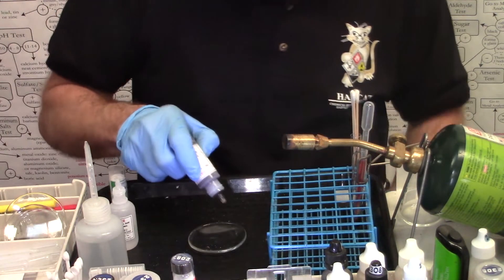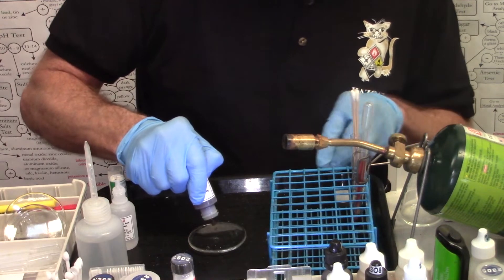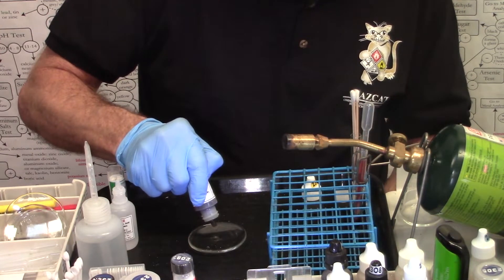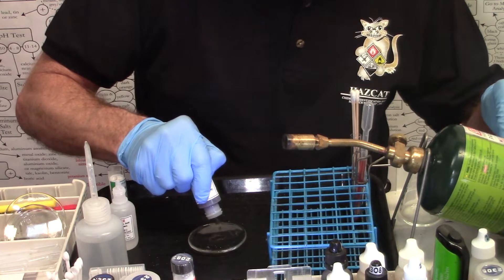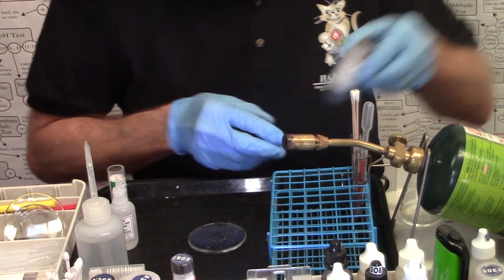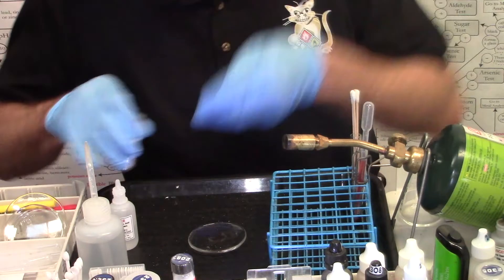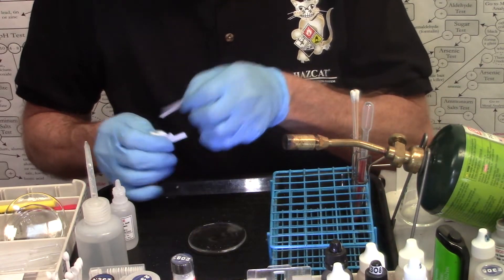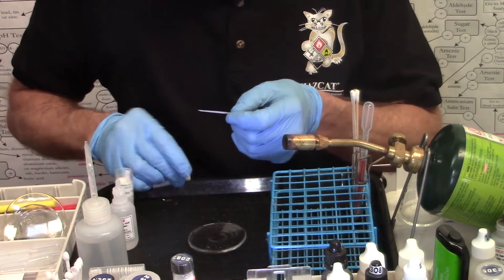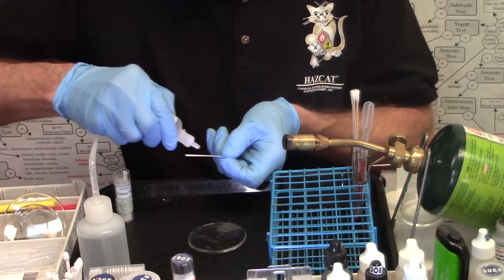Let's try it with another one. Twelve drops of the unknown liquid. One, two, three, four, five, six, seven, eight, nine, ten, eleven, twelve. Two drops of hydrochloric acid on my oxidizer test strip. One, two.